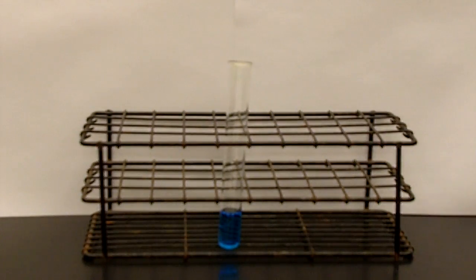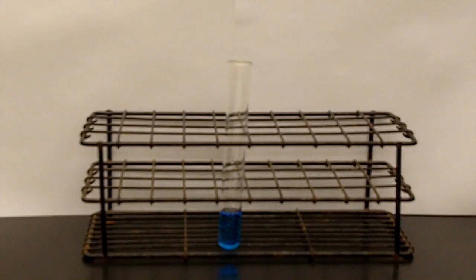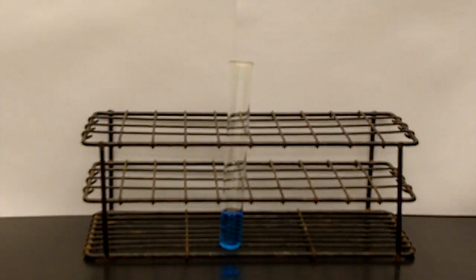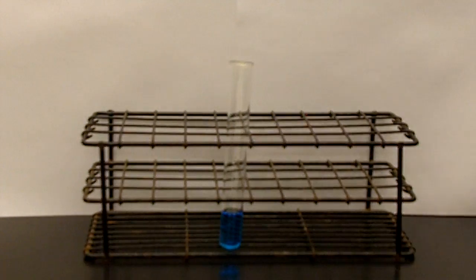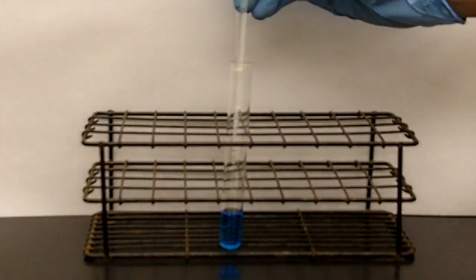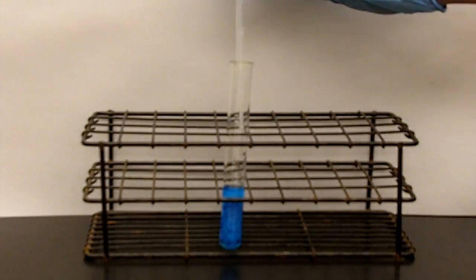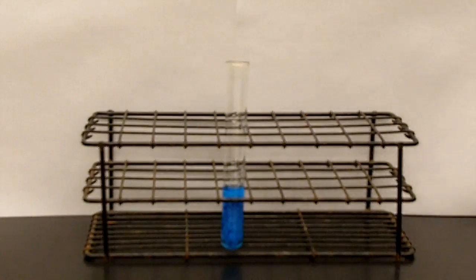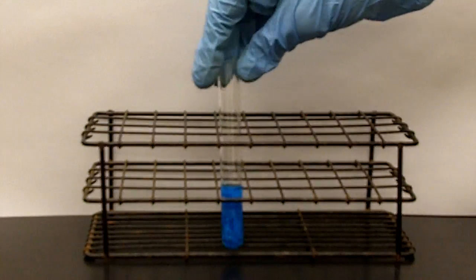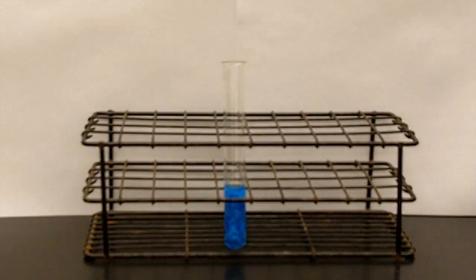In this first reaction, we have a solution of copper sulfate, and we're going to react that with some sodium hydroxide. As you can see, something has happened.